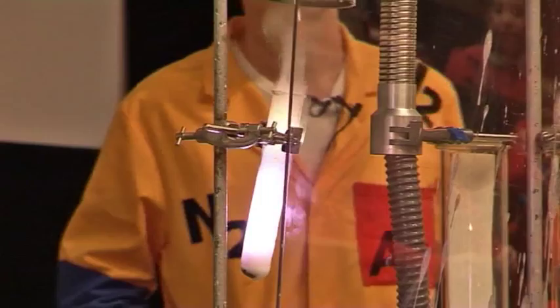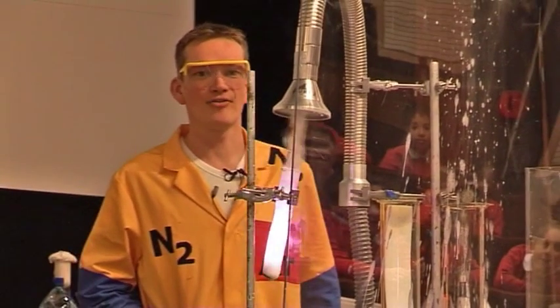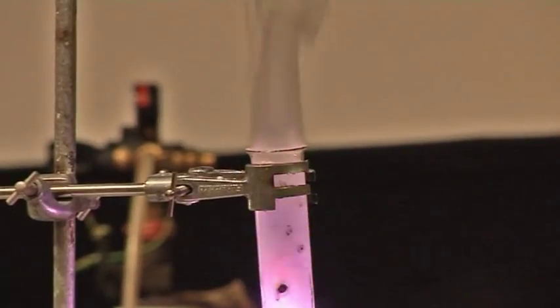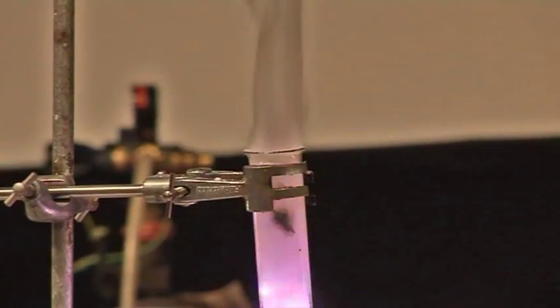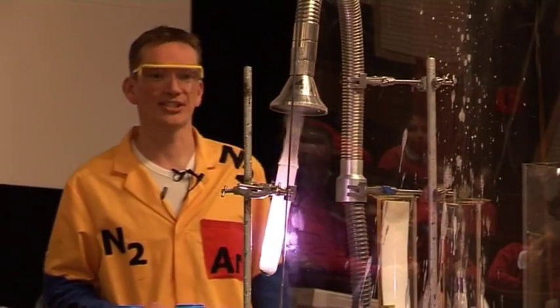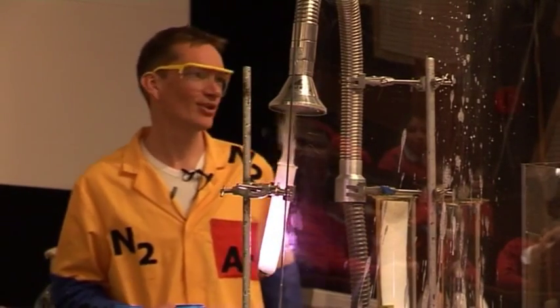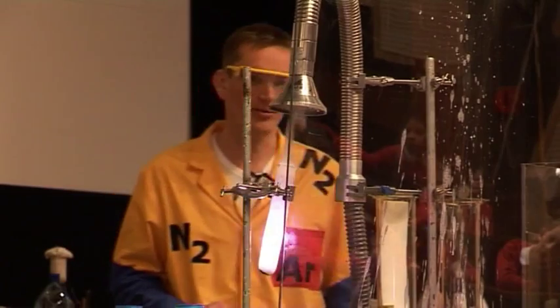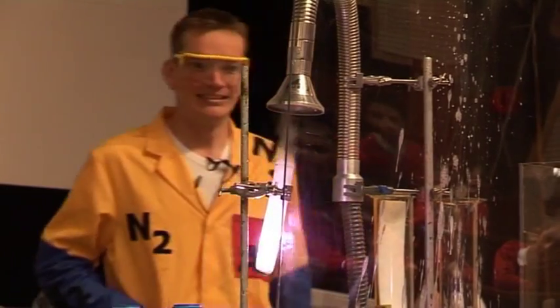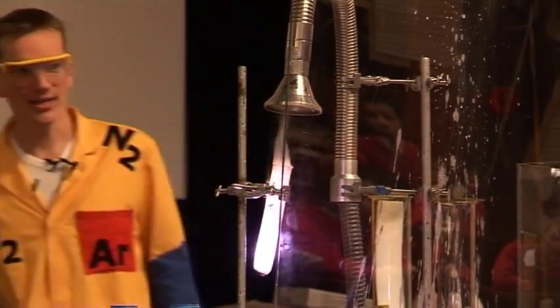Well, that was really rather violent, and that was all the sugar reacting with the oxygen from the potassium chlorate — and it's still going. Poor little jelly baby, there's not much left of him now. We'll just leave that one going.